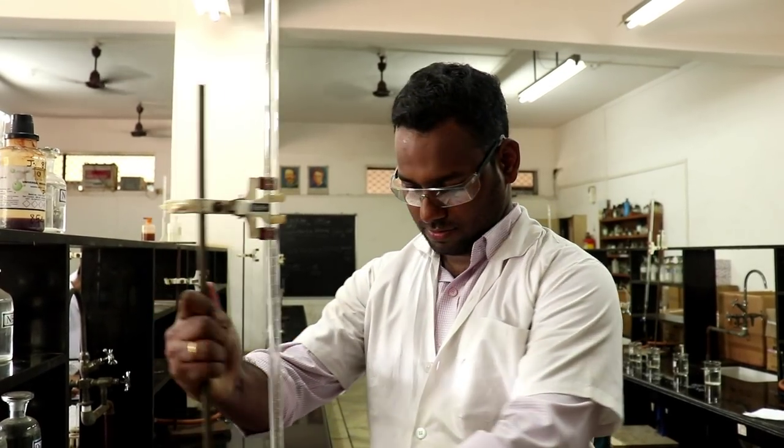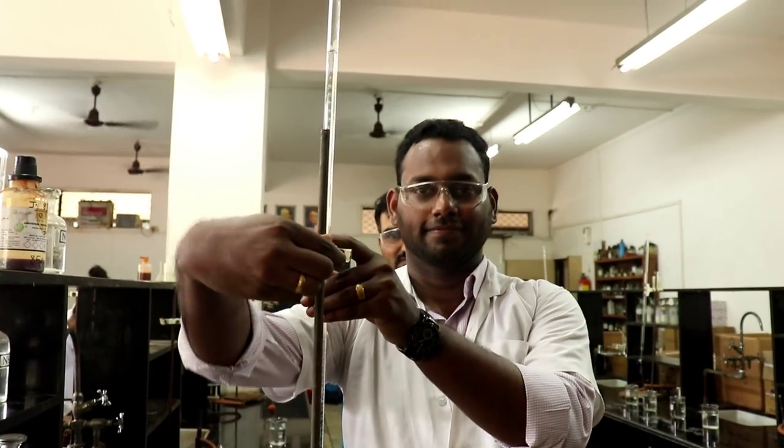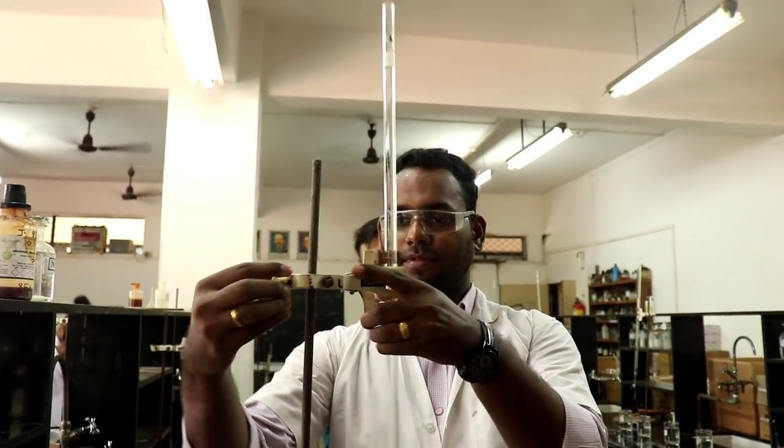You can arrange the burette according to your height by unscrewing and moving it in this way.